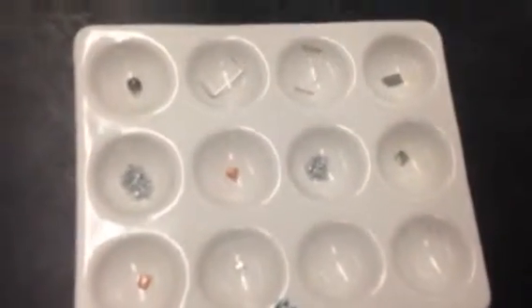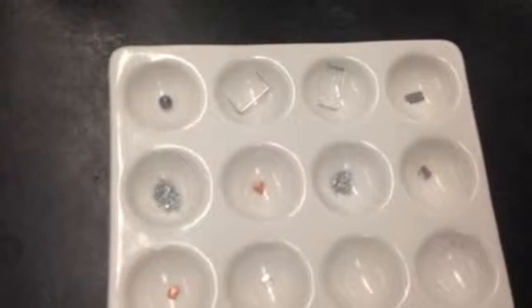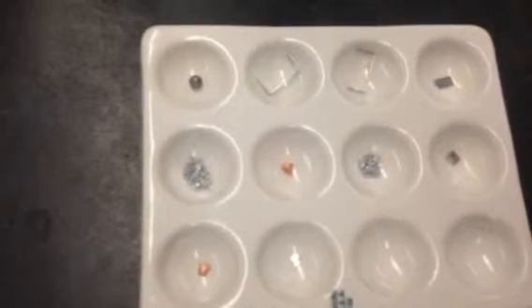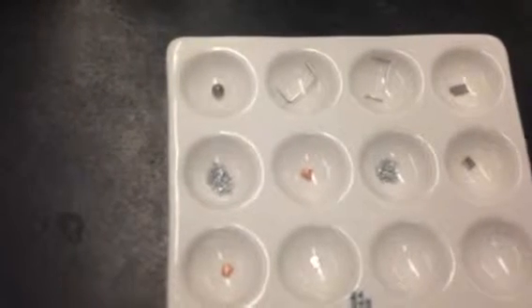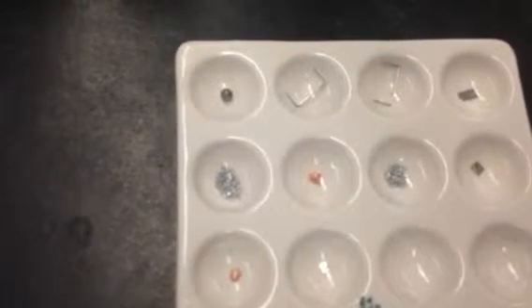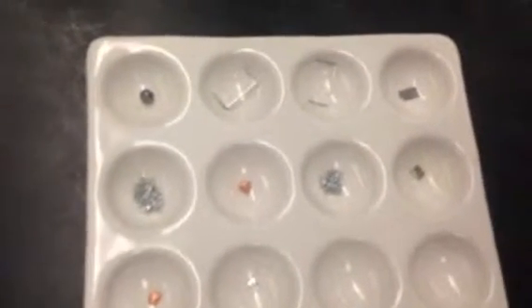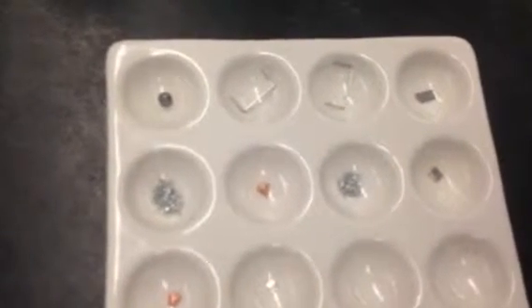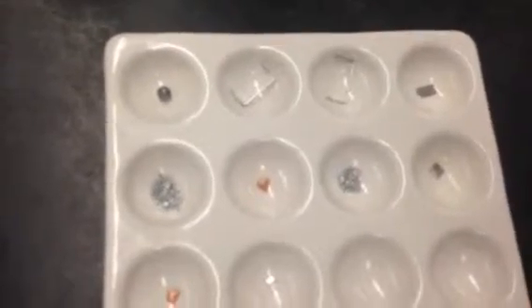And so when you go to write your balanced equations for any of the reactions that occurred, you should make sure you indicate the state of matter. All of these elements are metals, so the state of matter as an element would be a solid. And likewise, if you observe a reaction taking place, the element that gets displaced or replaced from the compound that becomes an element is also going to be a solid on the product side.